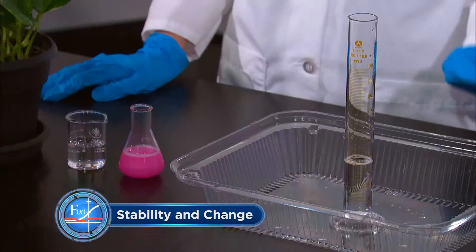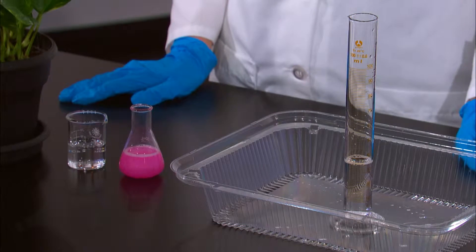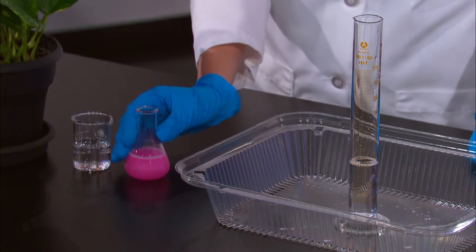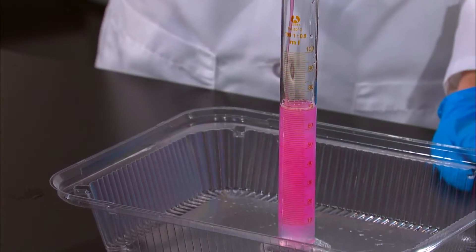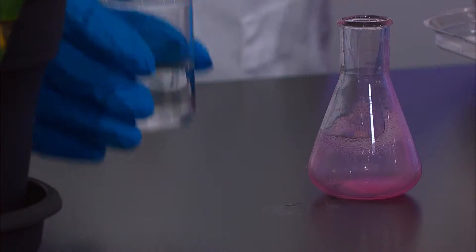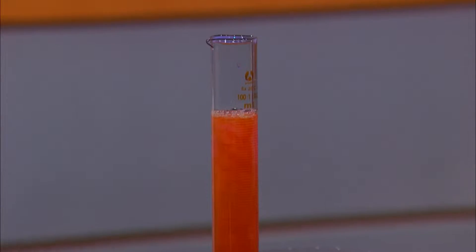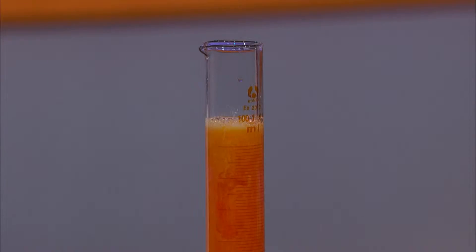Let's look at an example. In this graduated cylinder I have 50 milliliters of 30 percent hydrogen peroxide — the same stuff you've probably used to treat cuts, just at a higher concentration. I'm going to add 40 milliliters of dish soap. In this beaker I have a solution of water and potassium iodide. When I mix them together, you'll notice several signs of chemical change.